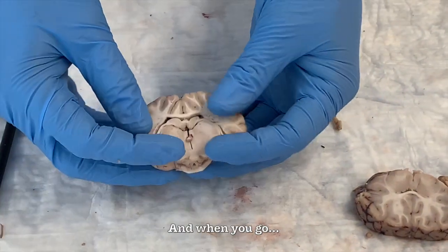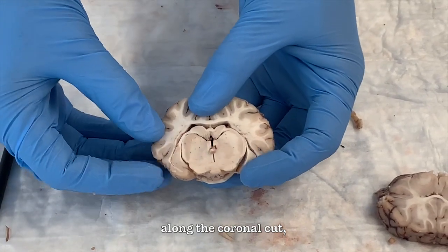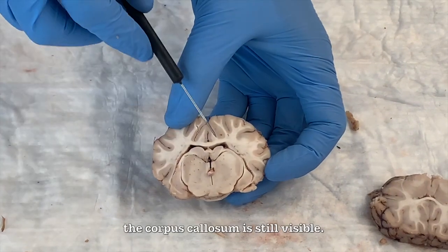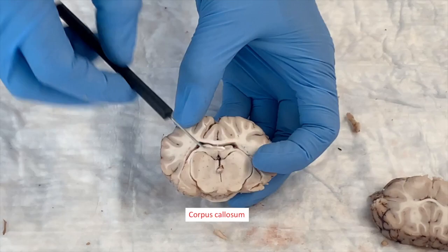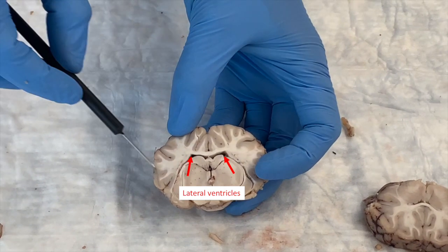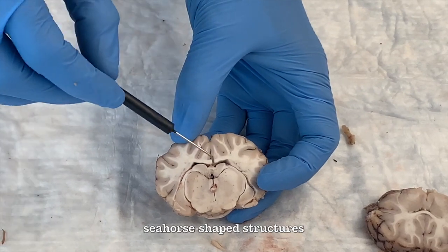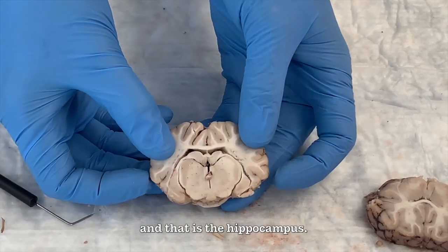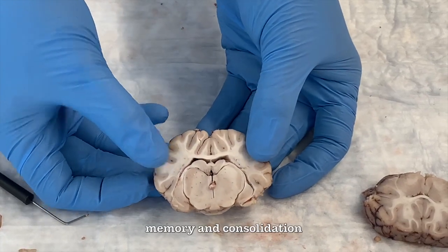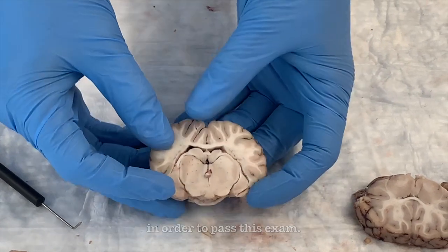And when you go even more posterior along the coronal cut, you see that the corpus callosum is still visible. Here are the two lateral ventricles, and you notice there are these two seahorse shaped structures, and that is the hippocampus, and that plays a role in memory consolidation, and that's what you're going to need in order to pass this exam.